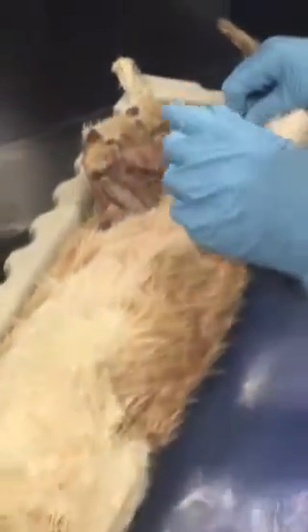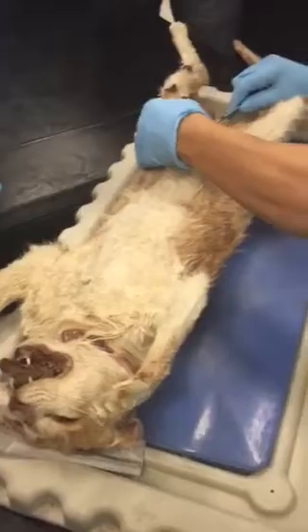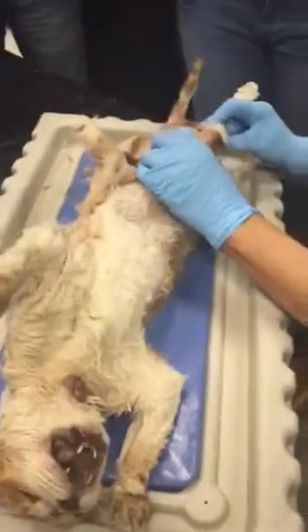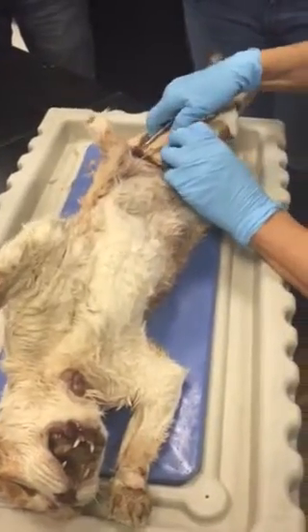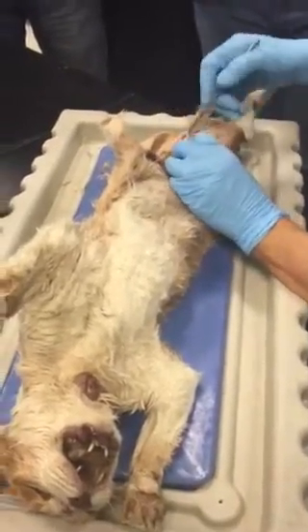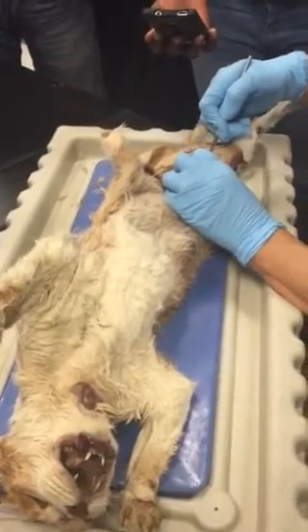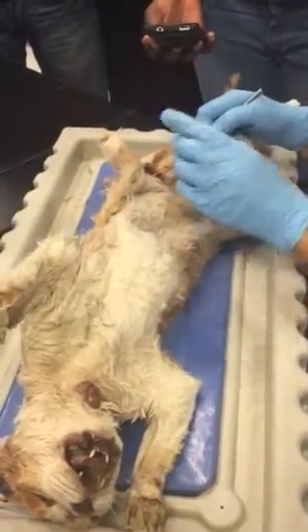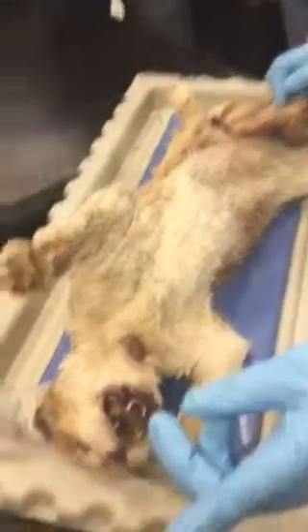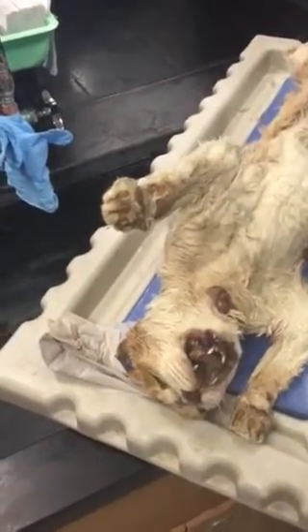What about the sciatic nerve? I don't know whether I can see it here. You have to go find it, feel the femur. It should be somewhere deeper. If it's there I could show it, but generally I don't. However, on that model, do you see the sciatic nerve? Right. Take a look, take a picture.